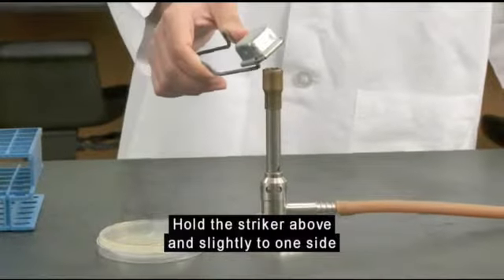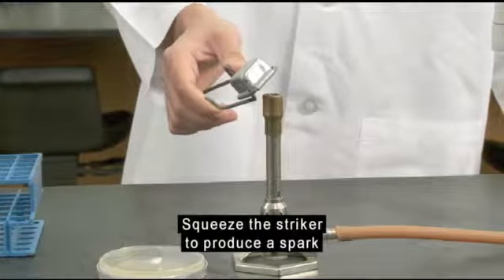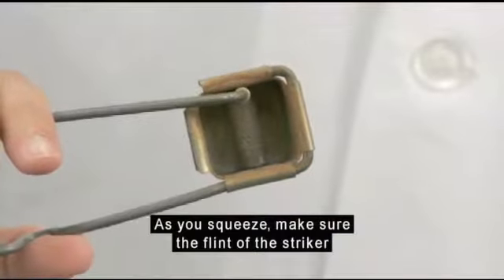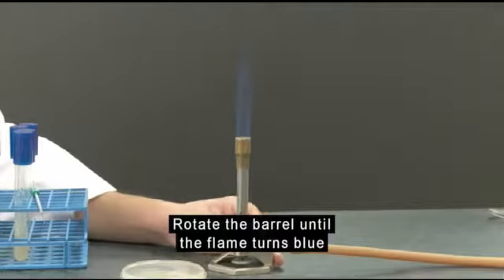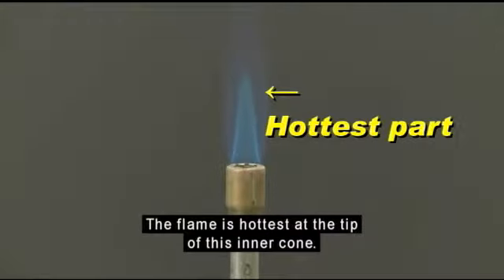Hold the striker above and slightly to one side of the opening of the burner. Squeeze the striker to produce a spark that lights the burner. As you squeeze, make sure the flint of the striker scrapes hard against the abrasive inside. Rotate the barrel until the flame turns blue and a bright blue inner cone appears. The flame is hottest at the tip of this inner cone.